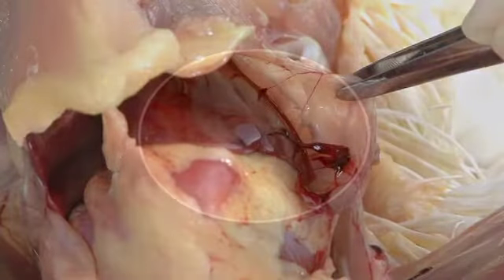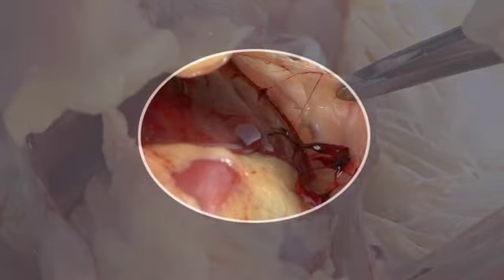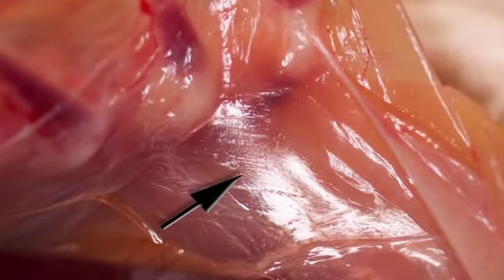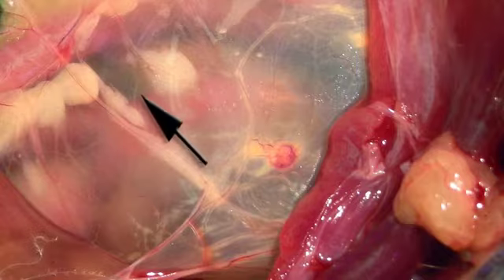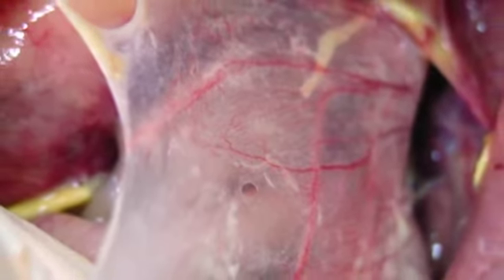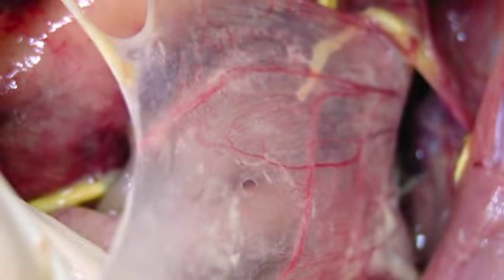The air sacs are thin membranes distributed throughout the body. However, they are often easiest to visualize beneath the keel and along the ribs. In a fresh, healthy bird, air sacs should be transparent, but the membranes will become slightly cloudy after death. In overconditioned birds, fat may be present on the membranes. Inflammation of the air sacs can result in thickened membranes, opacities, or fibrin deposition. Be on the lookout for any accumulation of fluid, foam, or exudate.